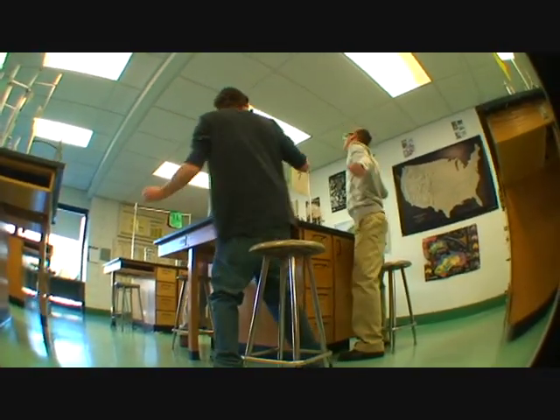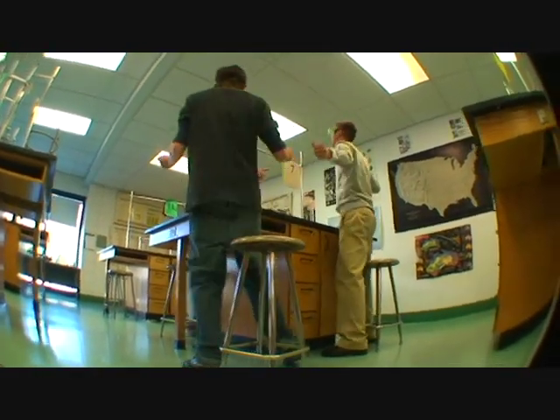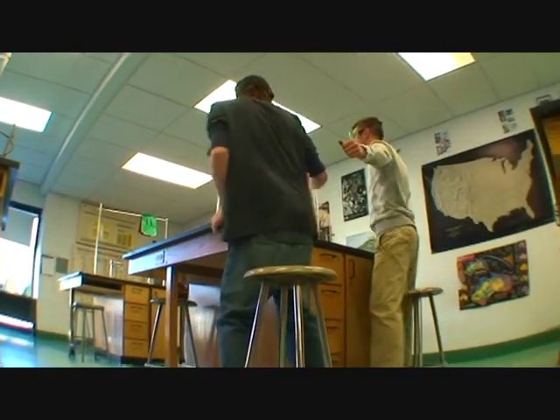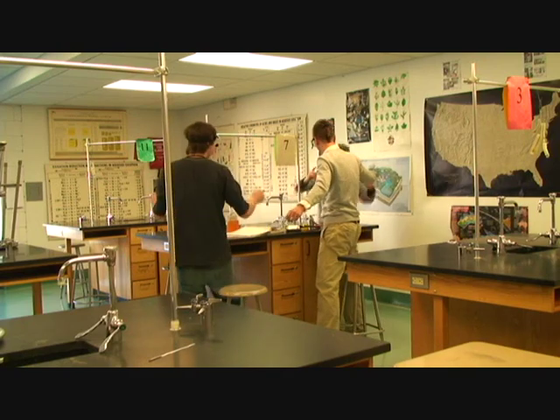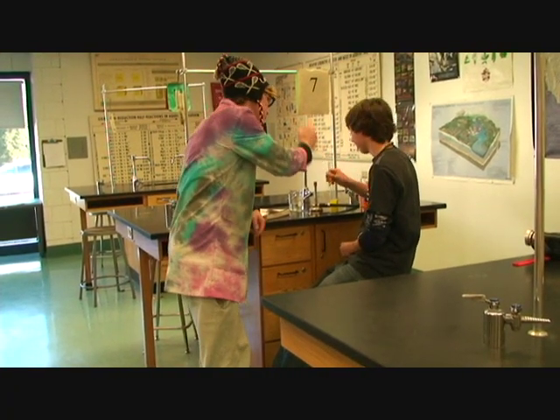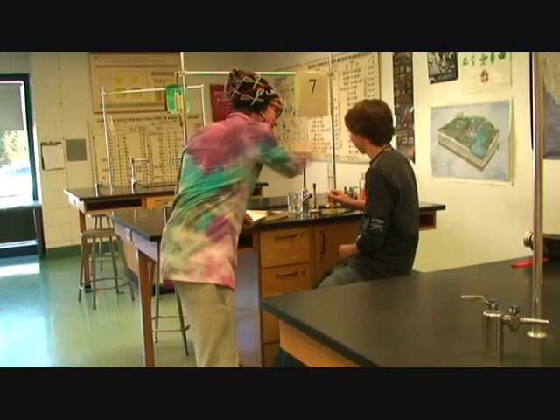No horseplay and dancing in my laboratory. What do you think you're doing, Missy? Dancing around? Is that an electronic device? Bad, bad, bad. Negative. Listen here, Ralph. There's no drinking chemicals out of test tubes.